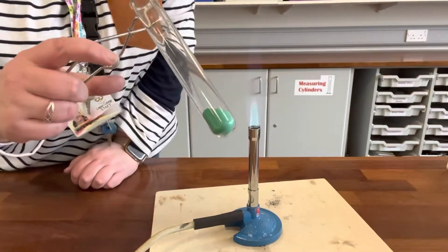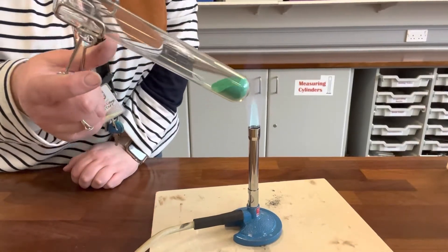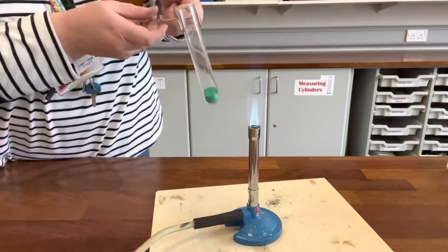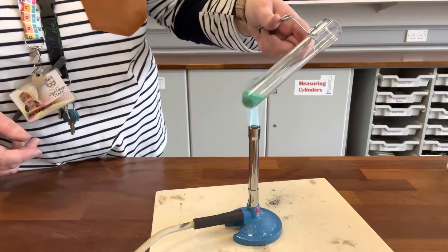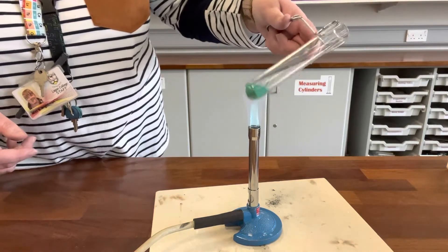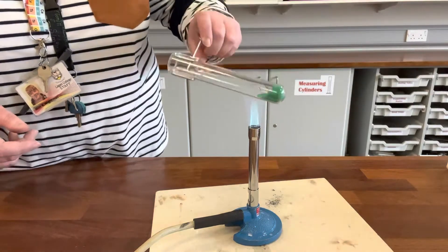Here we have a test tube with some copper carbonate and you can see that green colour. With a thermal decomposition reaction we're not adding anything else to it. All we're doing is heating this compound — it's the heat that causes it to break down. So when we heat it on the Bunsen burner it will start to decompose into copper oxide and carbon dioxide.